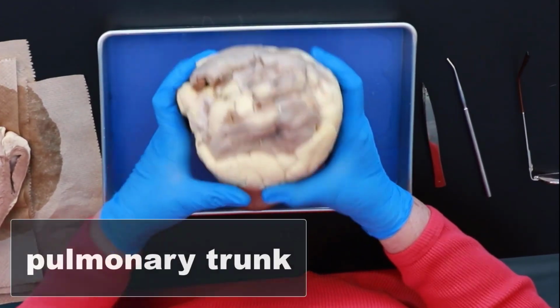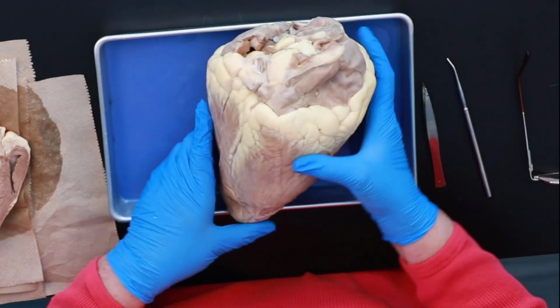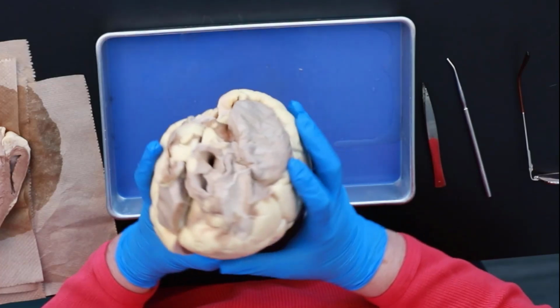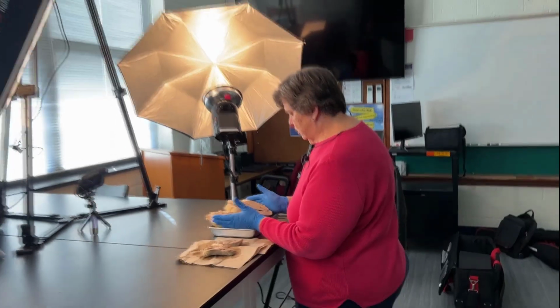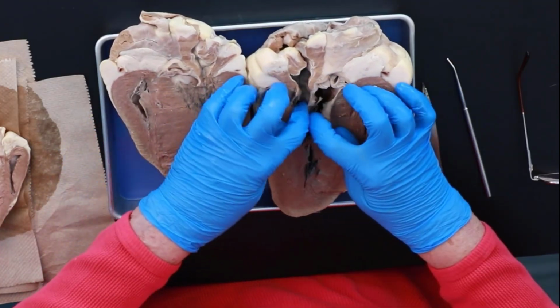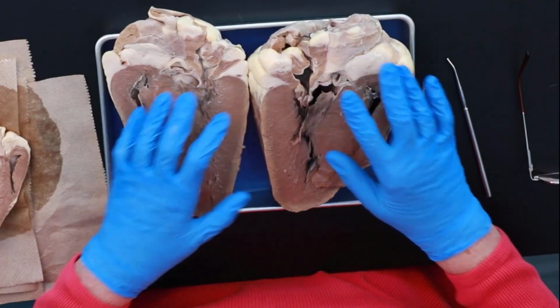First of all, this is your pulmonary trunk. This is the front of the heart. This is the pulmonary trunk. And you can see basically this area right here is the coronary sinus. We split this open and we can see the different divisions of the heart. Okay, so tissues, we have the epicardium, we have the myocardium, and then we have the inside, which is the endocardium, which we'll take a look at over here in the sheep's heart.